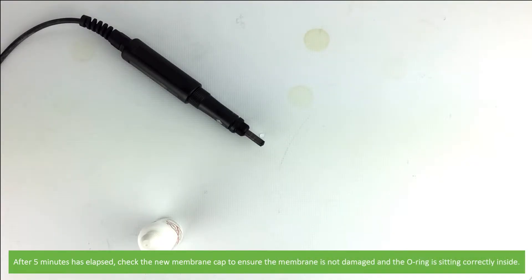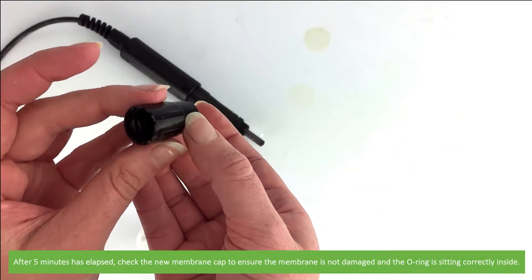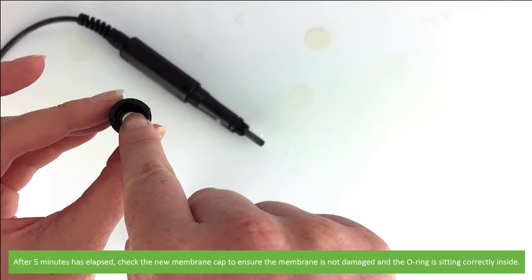After 5 minutes has elapsed, check the new membrane cap to ensure the membrane is not damaged and the O-ring is sitting correctly inside.